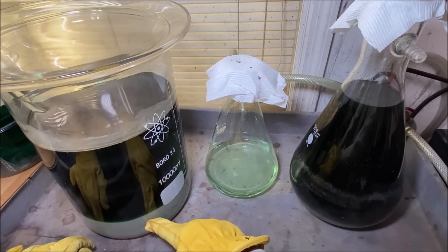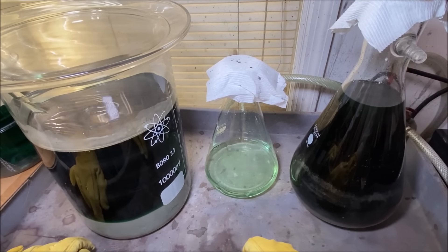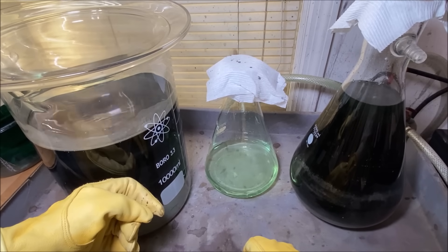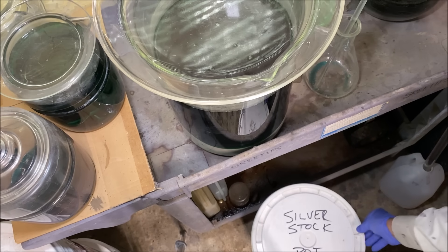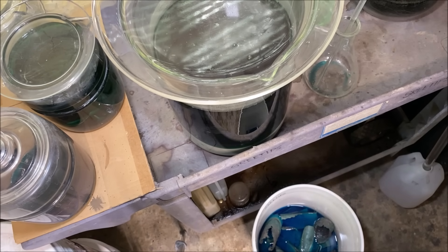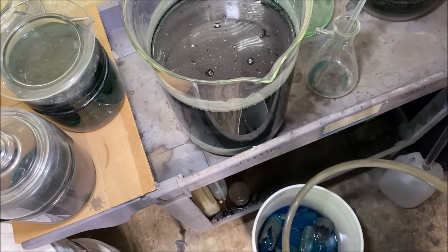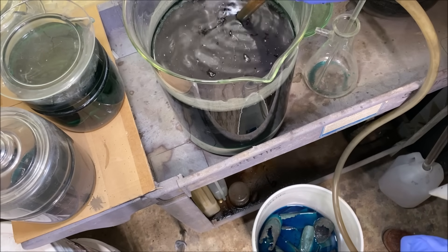The solution sitting on the silver is void of any precious metals — it's just going to be a waste solution. So I'll siphon this waste solution into my silver refining stock pot. This is my silver refining stock pot — it's full of pieces of copper. So what we're going to do is siphon off this waste solution down into it.